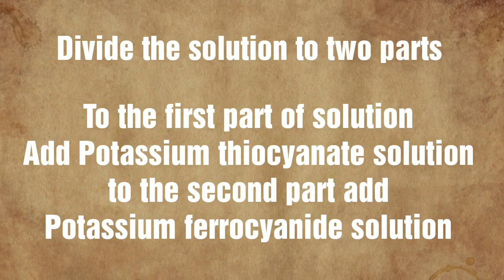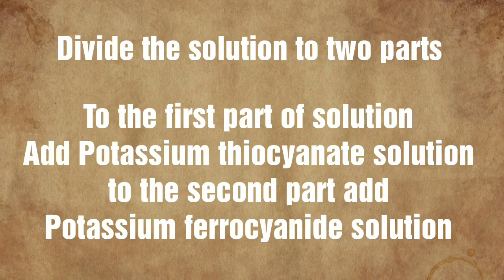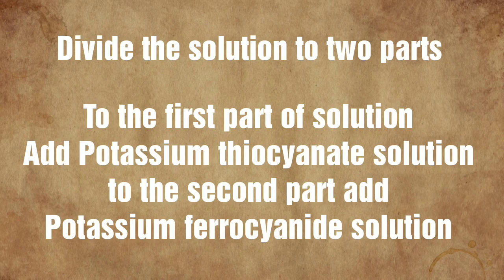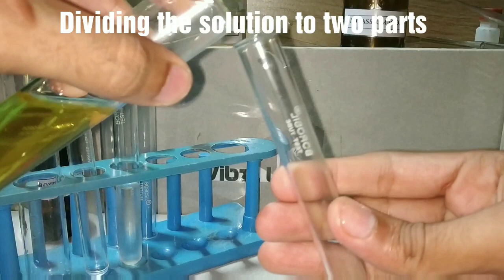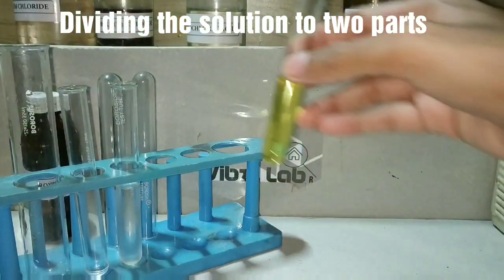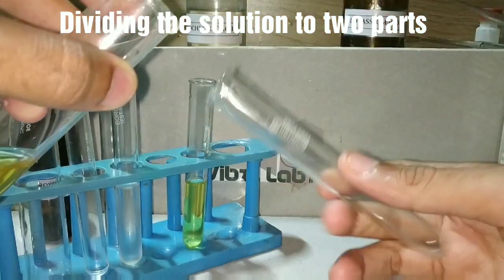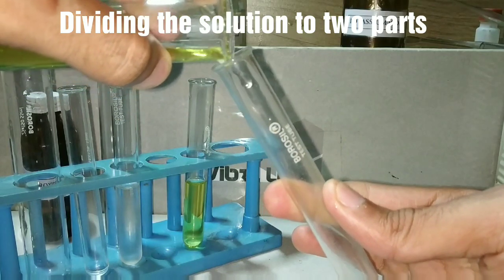Now we divide the solution into two parts. To the first part we will be adding potassium thiocyanate, and to the second part we add potassium ferrocyanide. We take equal amounts of this solution in two separate test tubes so that we can do the two separate confirmatory tests.